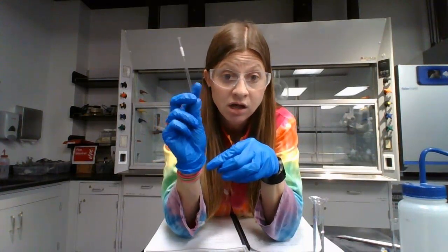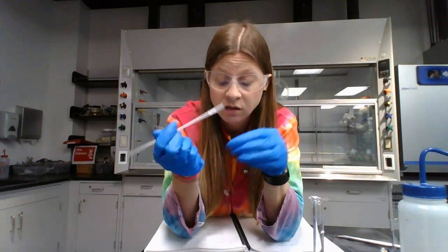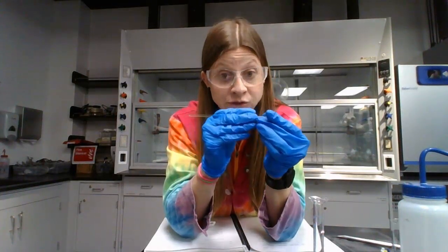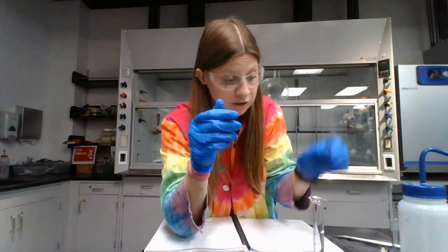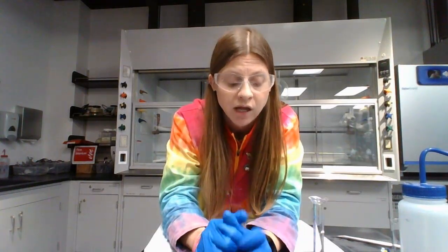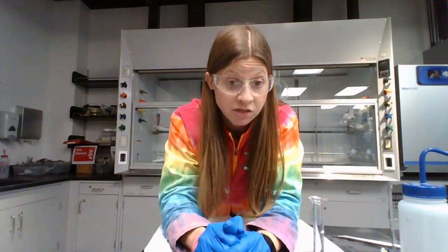So rinse out the NMR tube that had the food in it a couple of times with DI water before you put it in the container. Anything that had just salt or salt water, like your beakers with the standard in it, can just be washed like normal and then put away. Anything that had the Pedialyte or chicken broth also can be washed like normal, but by normal, I want to stress pretty well. We don't want the food stuff to be stuck in the glassware and for it to mold.